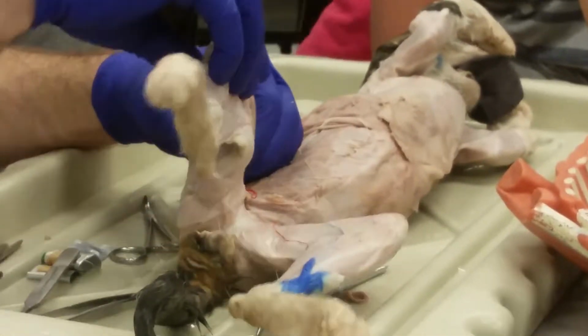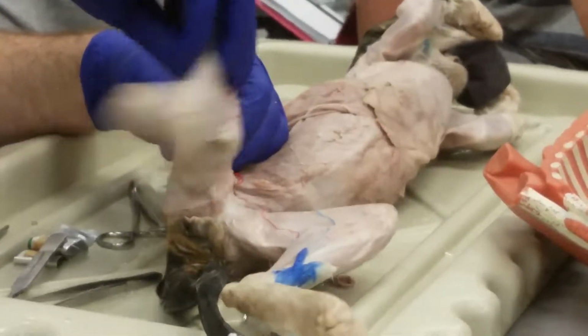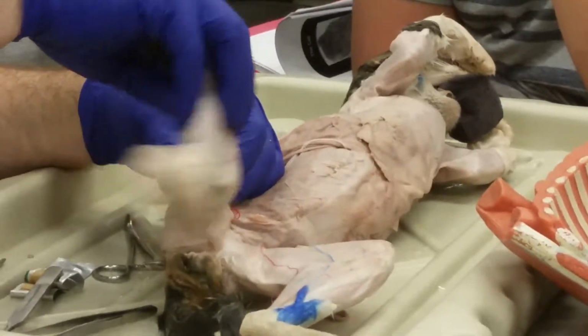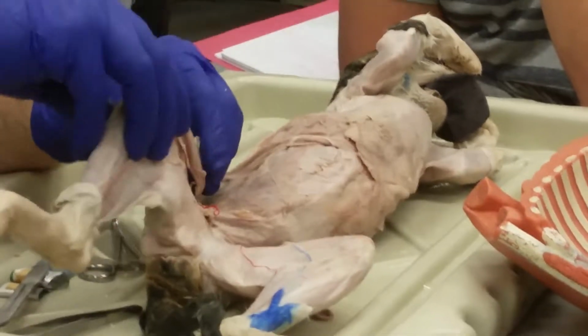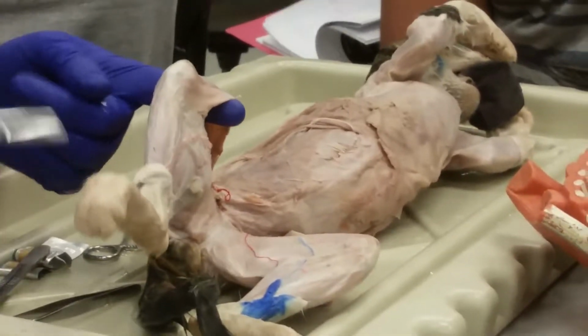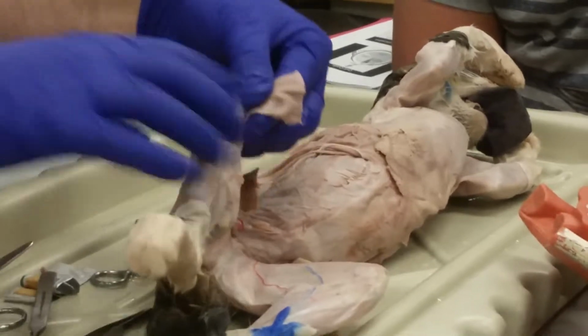Right? So if you flex your hip, flex your knee, and laterally rotate, you're out on the college quad, what are you doing? What are you playing? Yeah, well, you could be playing soccer. Got a little leather bag here. Hacky sack. That's why I call it the hacky sack muscle. It's all the motions for hacky sack. Okay? Sartorius. All right, so let's cut that one right along the midline and reflect it.